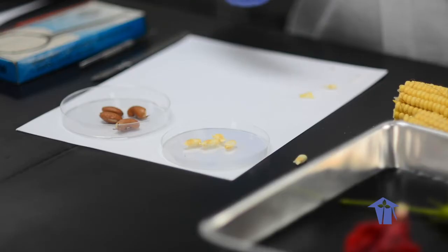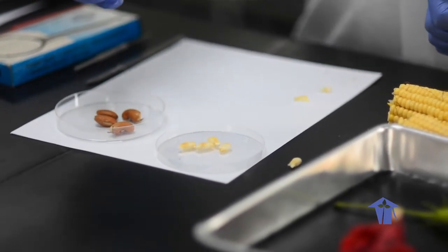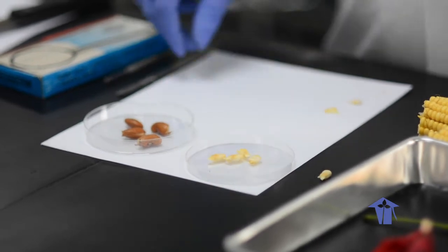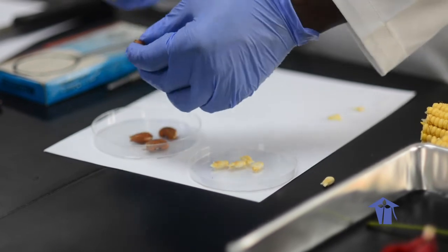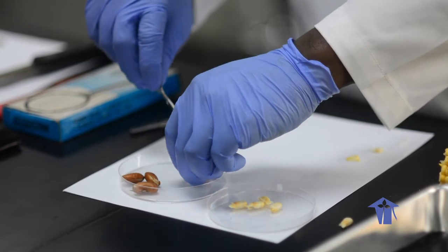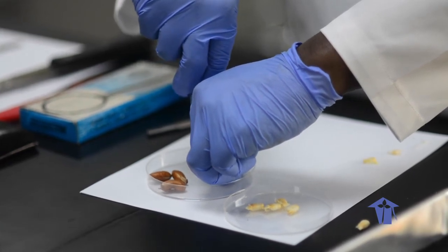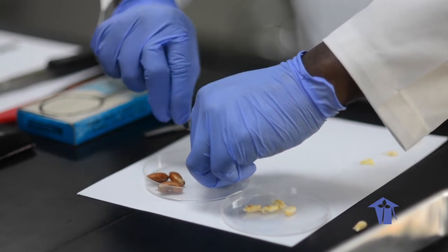Right. First, we dissect the flower, and within angiosperms, you have either dicots or monocots. The red bean is an example of a dicotyledon plant, and corn is an example of a monocotyledon plant. Right. So we dissect first, dissecting a dicot seed. Right. So for this part, we want to cut longitudinally. And again, as with the flower, it's a light cut. Right. So we don't want to penetrate too far.